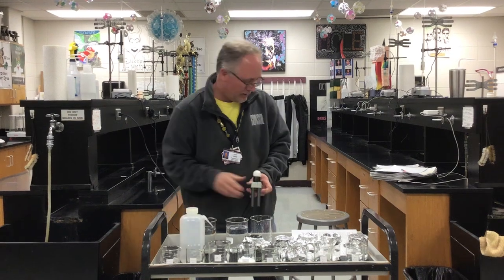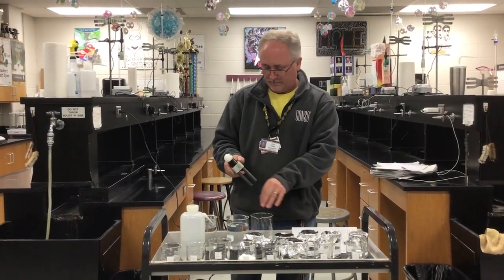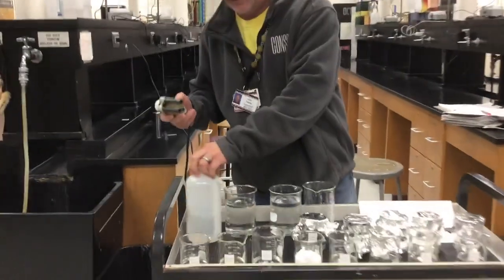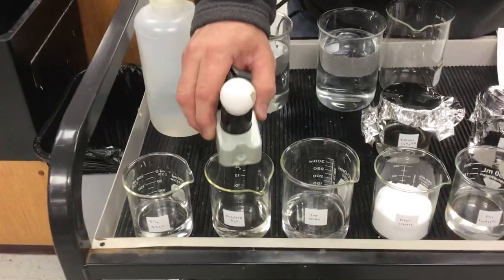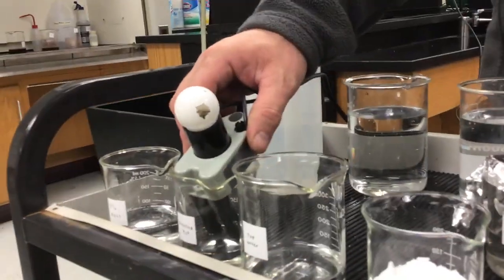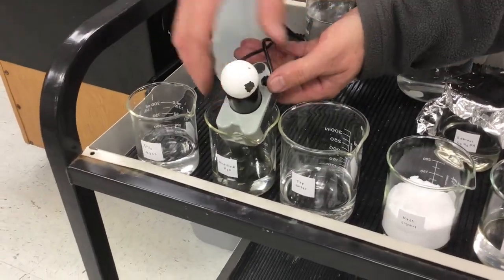The second one I believe is distilled water, and I may get my laboratory assistant to come in close and take a look at this one. We'll place it in the solution. Michael, can you turn off the light back there real quick? See if you see anything lighting up there at all. Do you see any kind of light, maybe just a tiny bit? No. Okay, will you turn the lights back on?